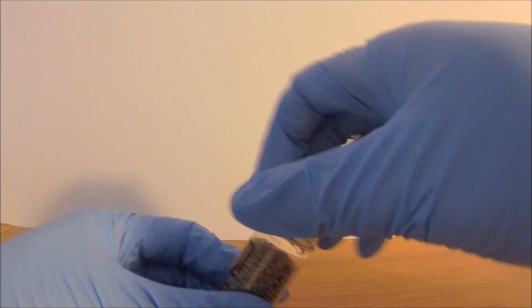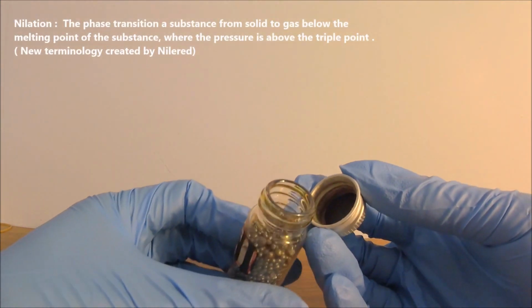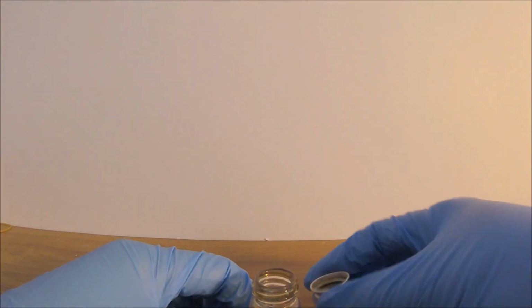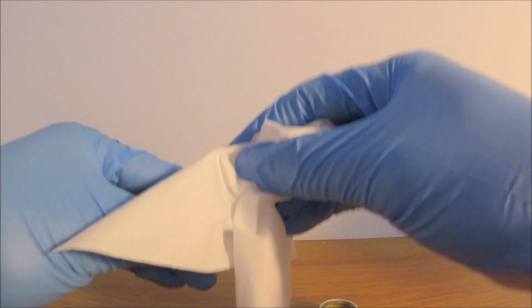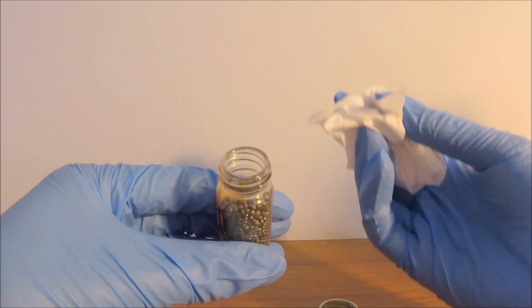Okay, let's unscrew the cap. The cap looks fairly dirty from the sublimation of iodine over the past year, but the whole structure still looks intact. Okay, the ring is not as dirty as I expected. It seems like the leakage did not occur here. I wonder where that is.